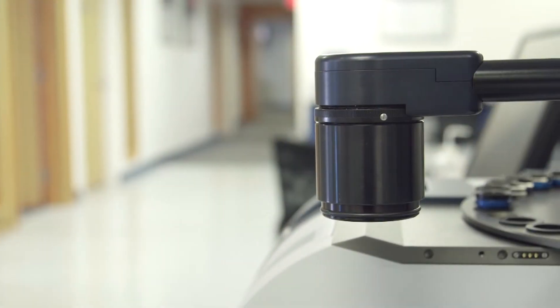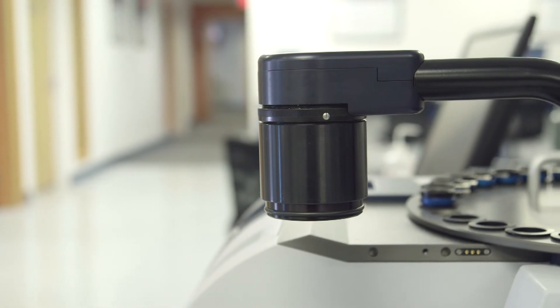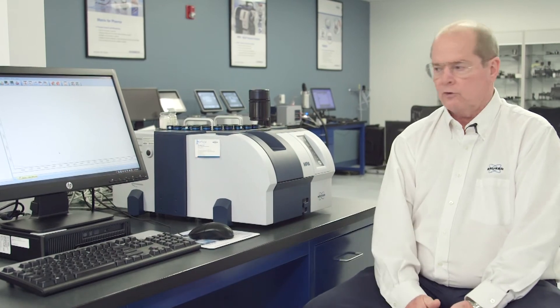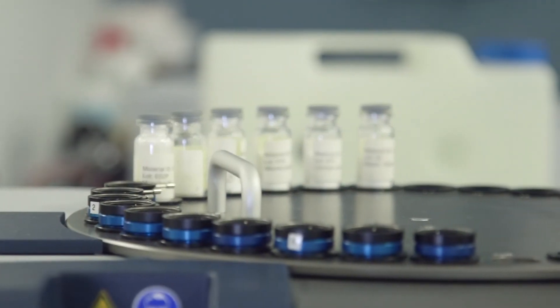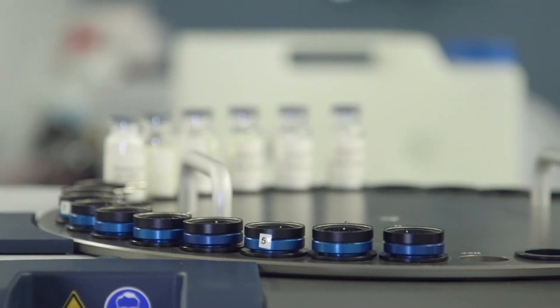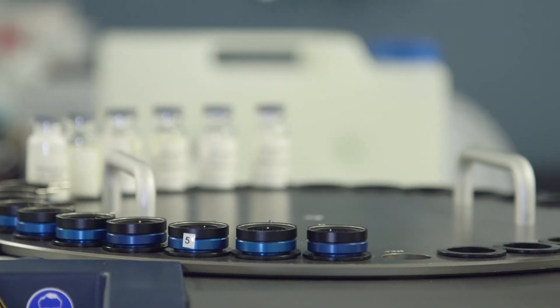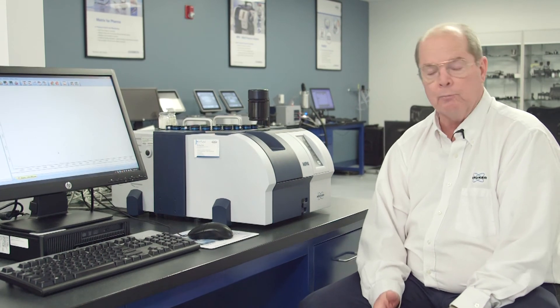You can also use the external transmission channel for doing tablet transmission for looking at content uniformity in pharmaceutical tablets. The 32 position auto sampler tray can be set up with a variety of custom diameter tablet holders for measuring the content uniformity in tablets by transmission or by reflection.